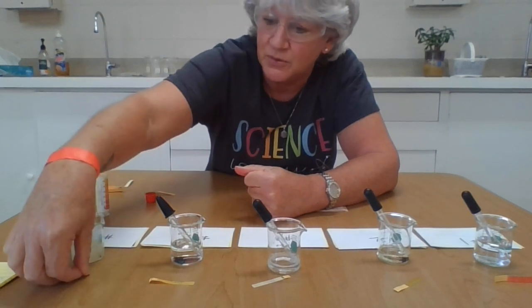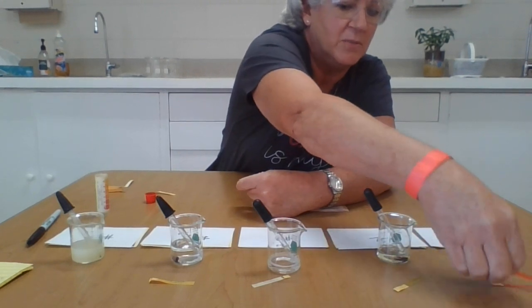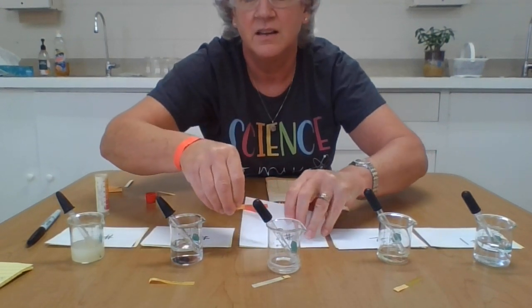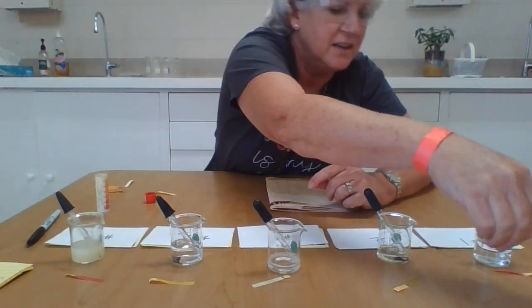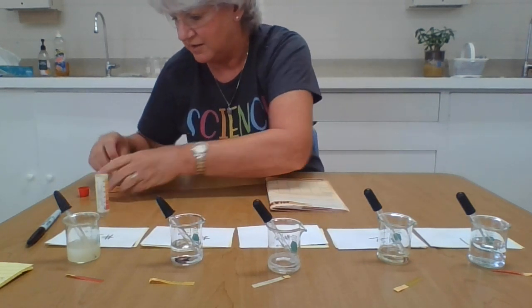And then finally, number 5 turned that hot pink red color, the same thing that I had in number 1. You can see these are the same color. I wonder if they're the same substance. Can you see that? Hopefully you guys can see the color there. They're not the same substance, you can tell, because guess what? This one's clear and this one has a yellow tint to it. So, are you ready to know what they are?